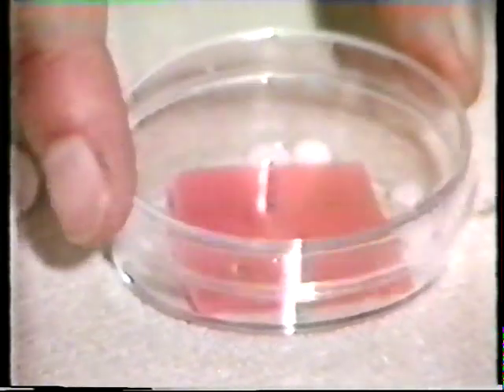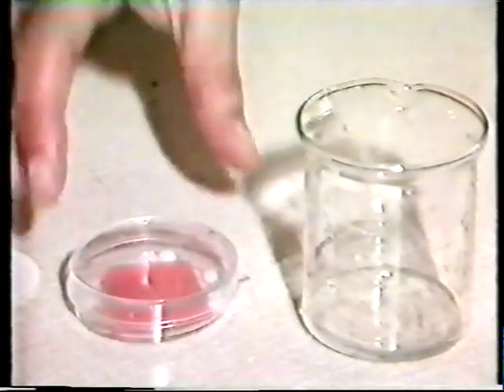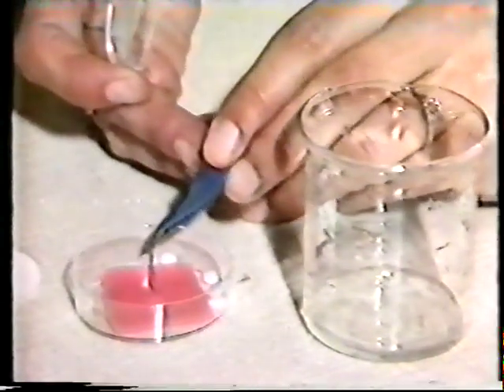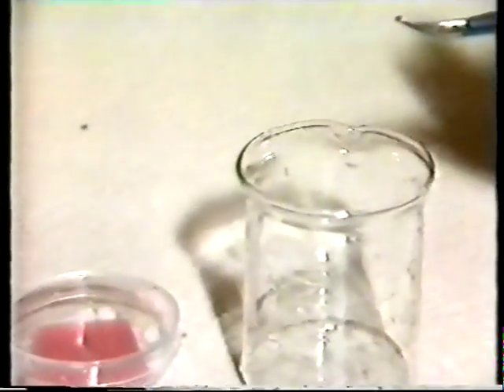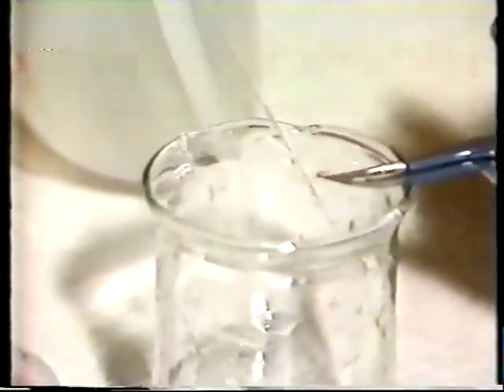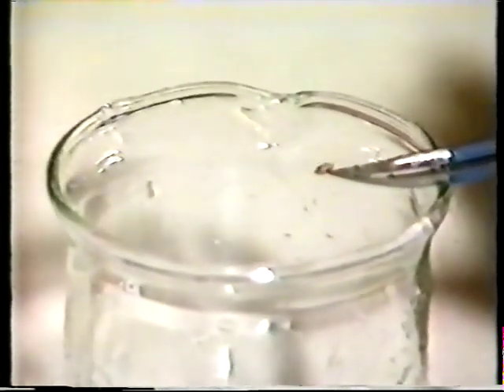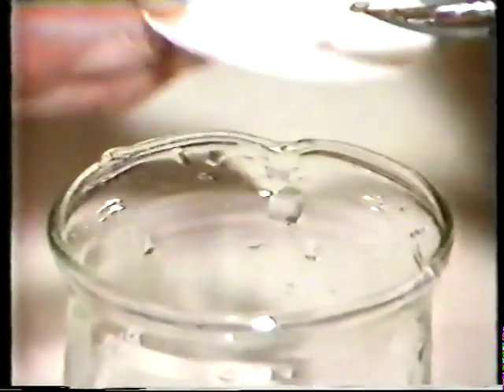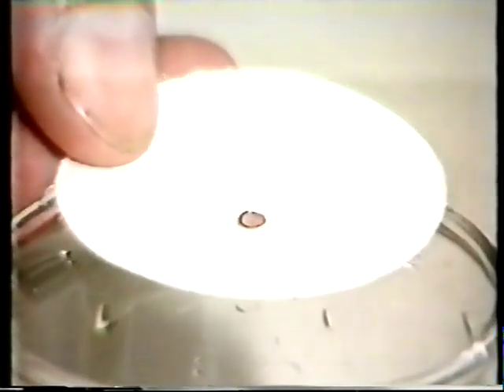Staining with a second compound, lead citrate, makes use of the ability of the lead salts to selectively bind to lipids. By this double staining technique, the contrast of cell components and membranes is greatly enhanced.